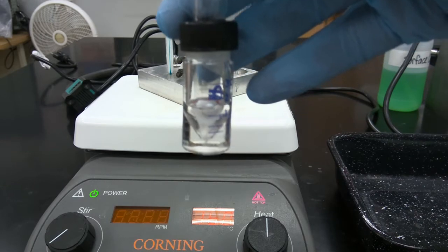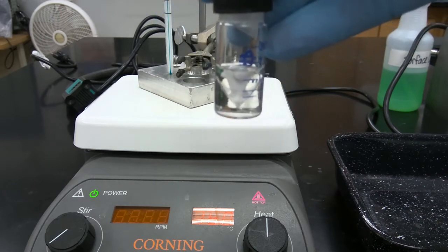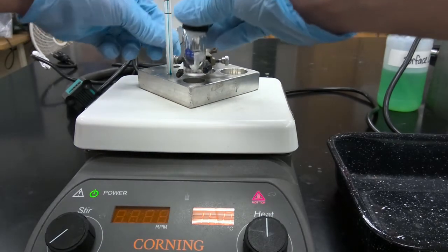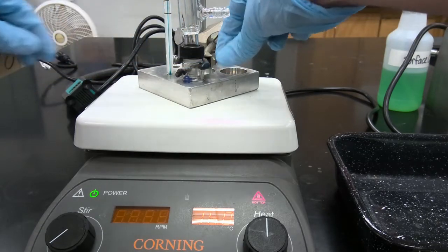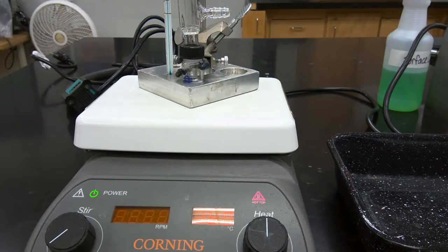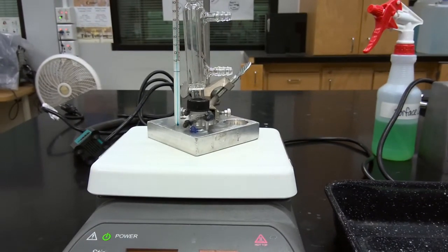Okay, so we've assembled our setup and we've mixed our reagents. What we're now going to do is install and clamp down our conical vial into our heating block. Our heating block is still in the process of warming to the target temperature. So we're trying to heat to a bath temperature of about 120. In the meantime, we're going to get our cooling system and cooling bath set up, and we'll resume once we've reached the target temperature.